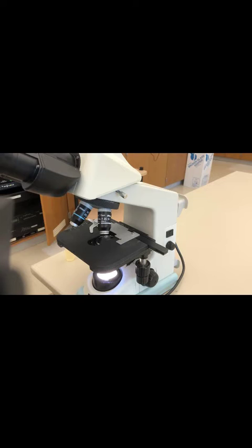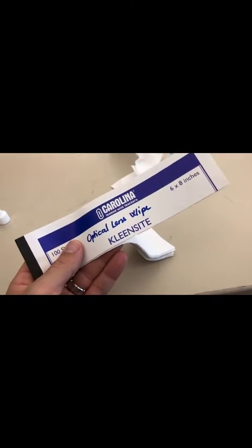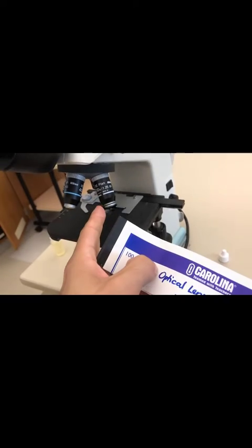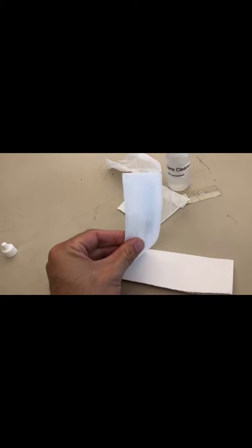But with the other objectives, remember, they all need to be cleaned too. All these objectives need to be cleaned, especially the 100x that got oil on there. To do that, you're going to need optical lens wipes to wipe the lenses. Make sure you don't use kim wipes for lenses.